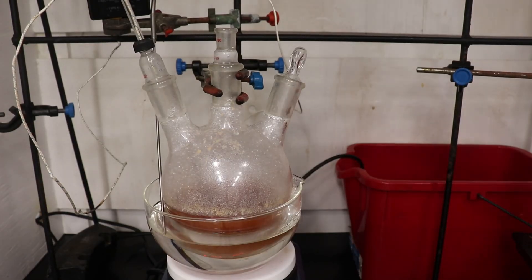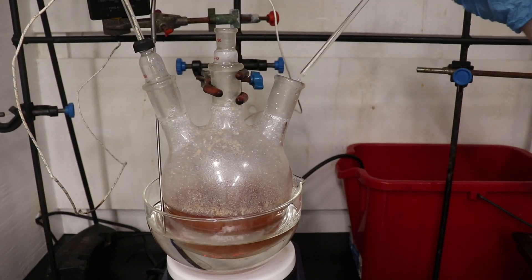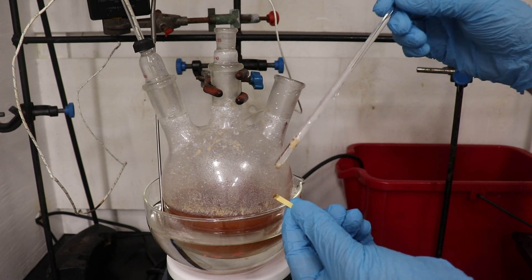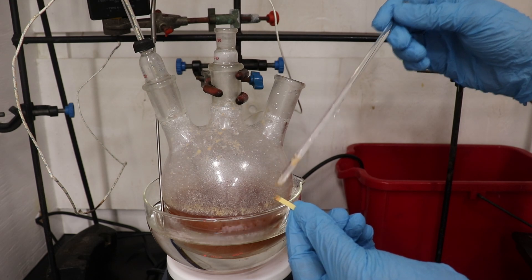Here I'm checking the pH of the mixture because I want it to be basic after the heating period. However, when I check it, the pH is neutral, which means that there still could be dimethyl sulfate present in this mixture.